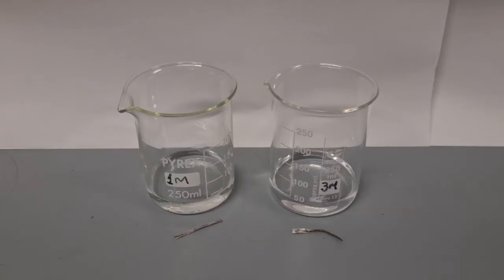In this video, I'm looking at the reaction between magnesium metal and hydrochloric acid.